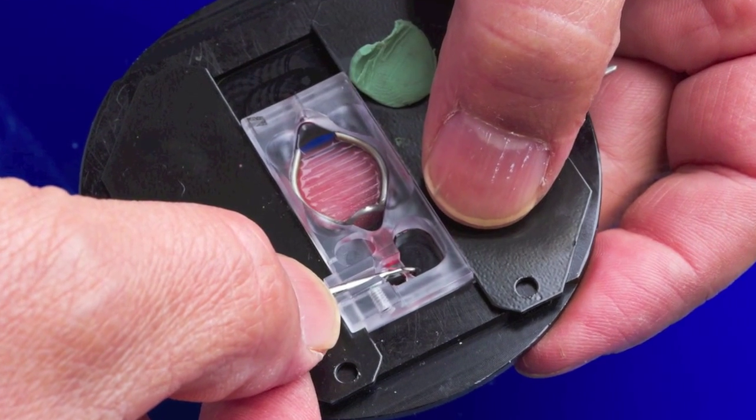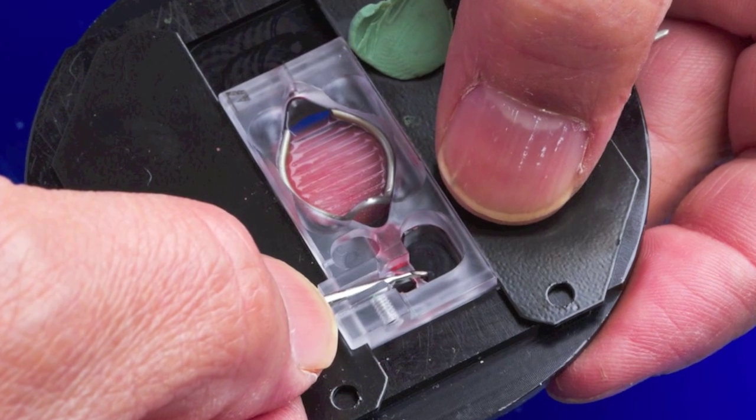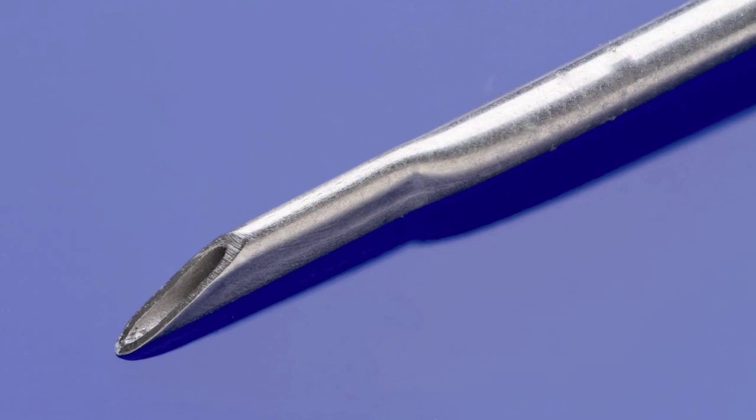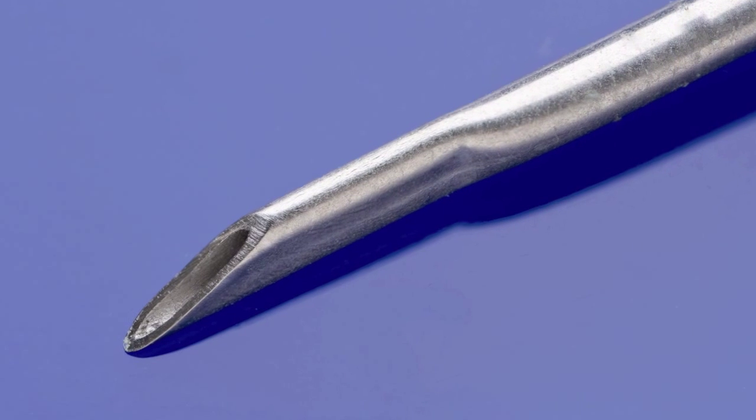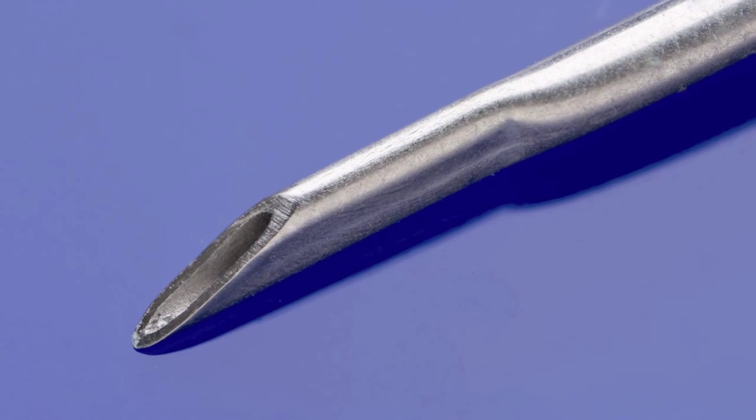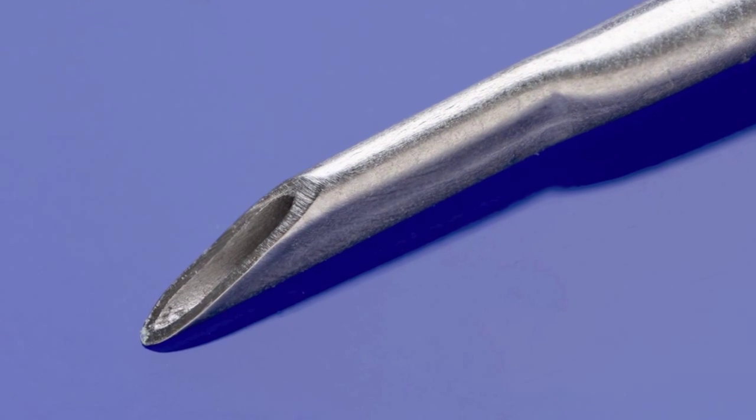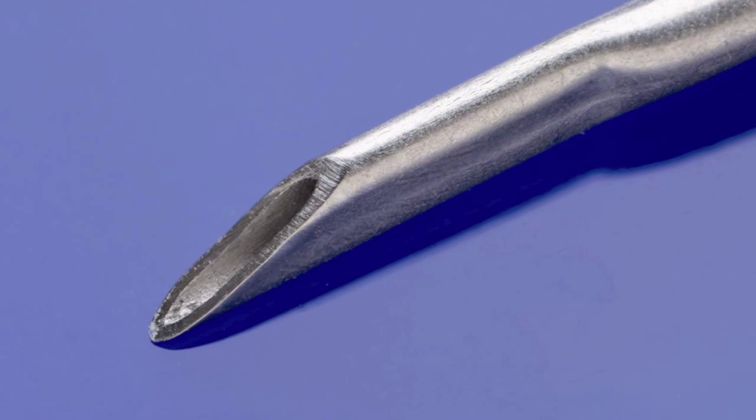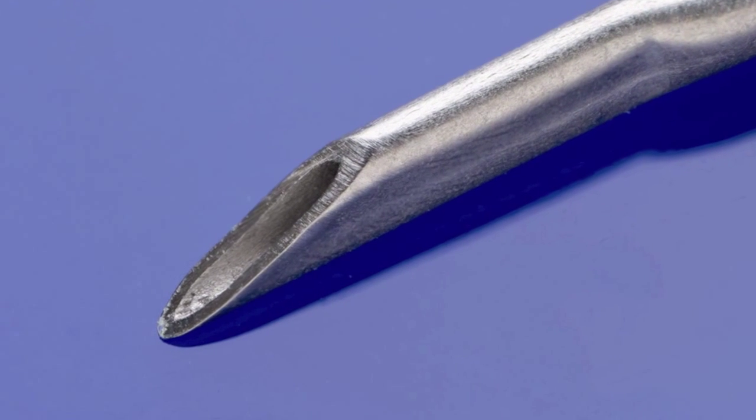Bath height is set by the position of the suction tube angle relative to the suction well. Suction height is adjusted by changing the angle of the beveled suction tube within the suction well of the series 20 chamber. The set screw can be used to fix the set angle.